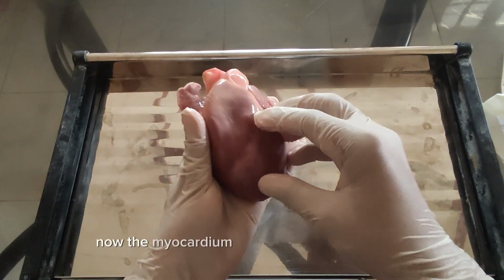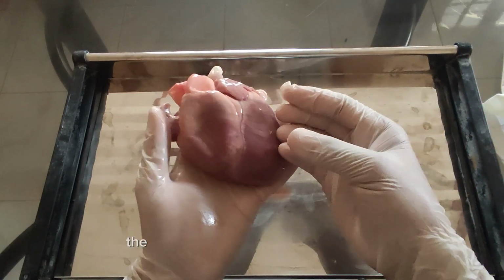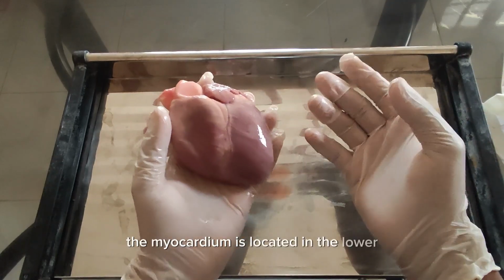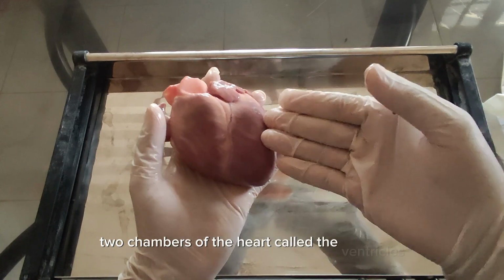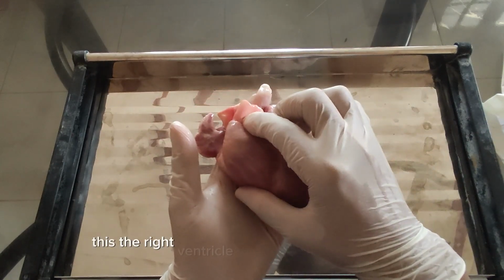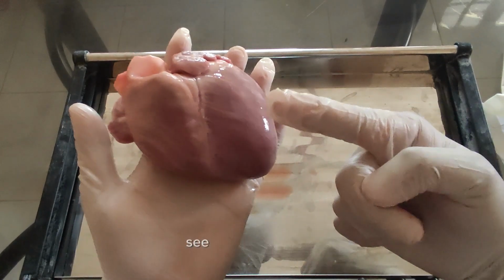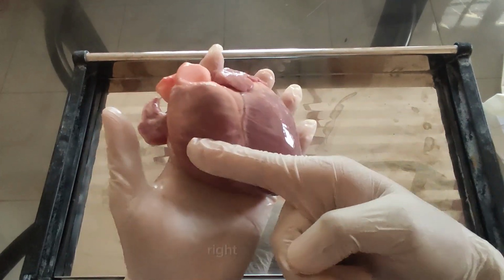The myocardium is the muscle of our hearts, and most of the myocardium is located in the lower two chambers of the heart called the ventricles. These are the ventricles that we have here. This is the right ventricle and this is the left ventricle. See? The left ventricle, right ventricle.